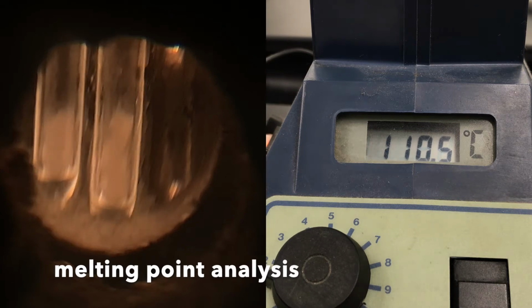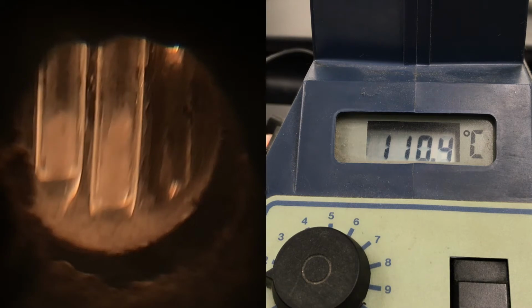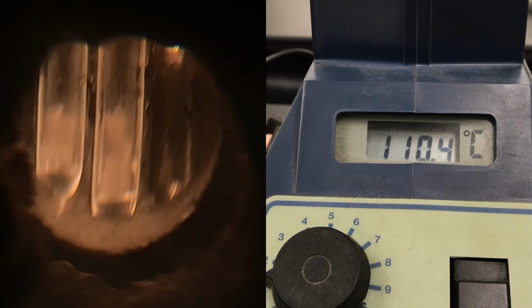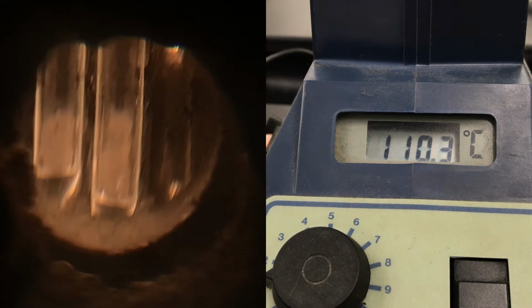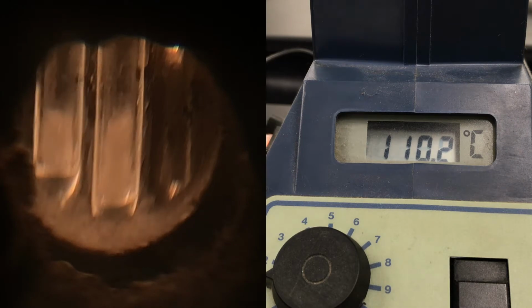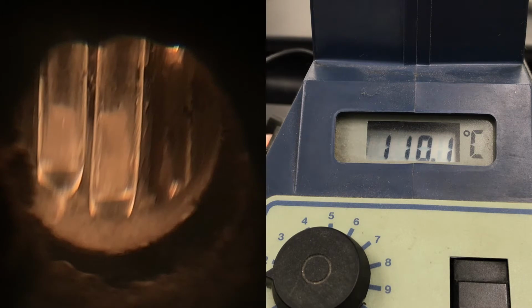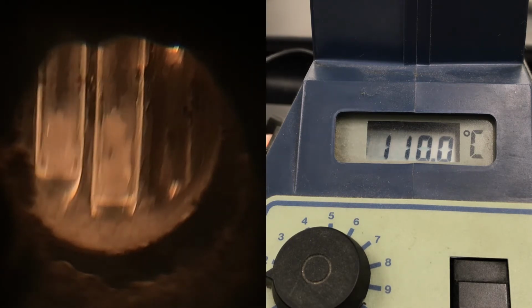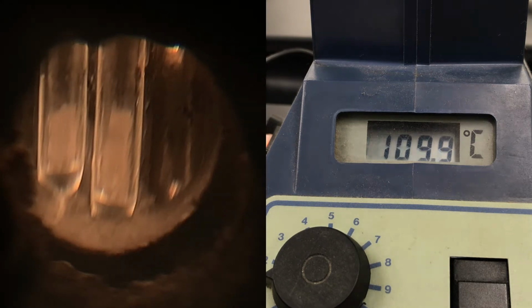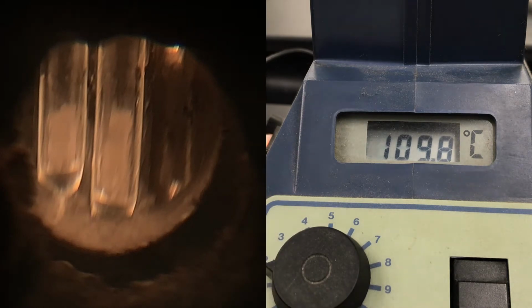Okay, so I've put the samples in. The left sample is the Lauren Oils sample, and the middle sample is the Traverse Bay body and bath. And the temperature there you can see on the video is about 110 degrees. So kind of hard to see these samples, but you can see how they are translucent or maybe opaque. And so we're going to go ahead and set the dial here a little higher and let this melt.